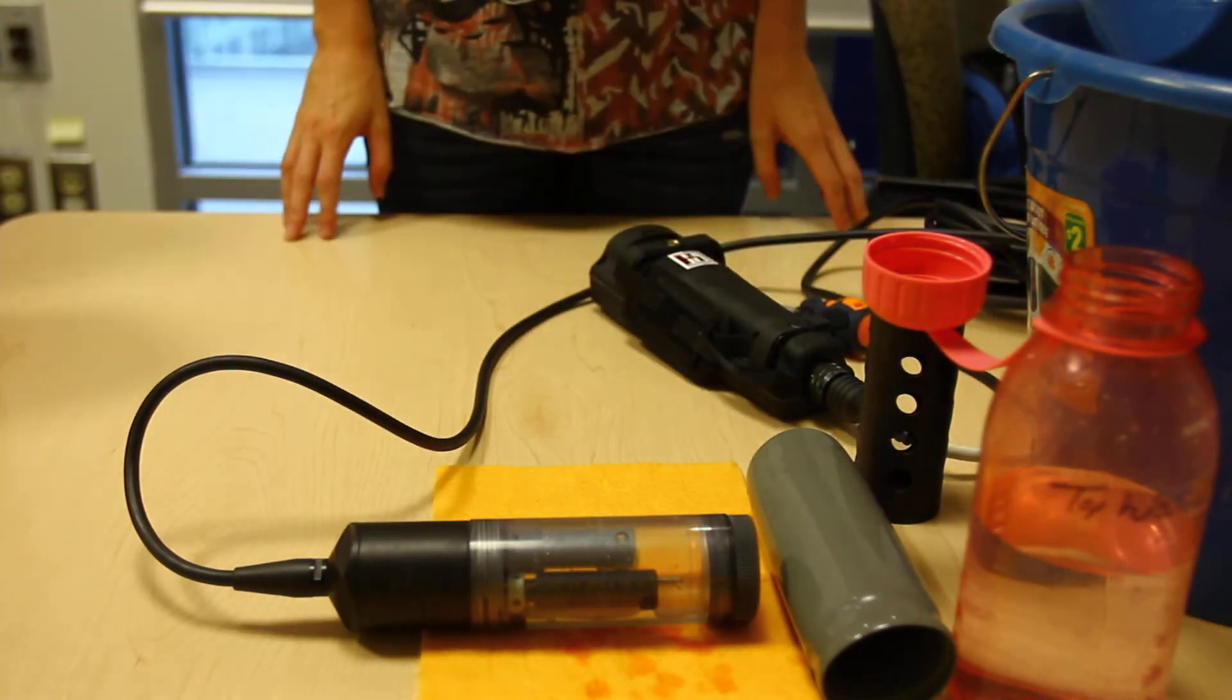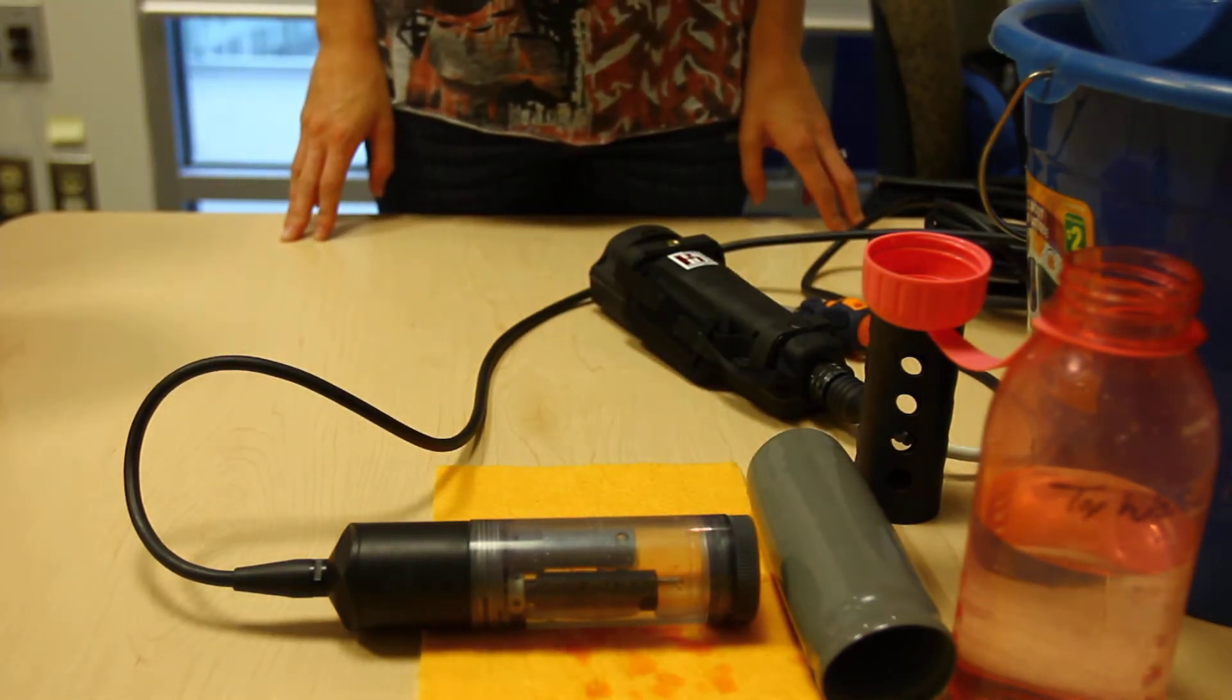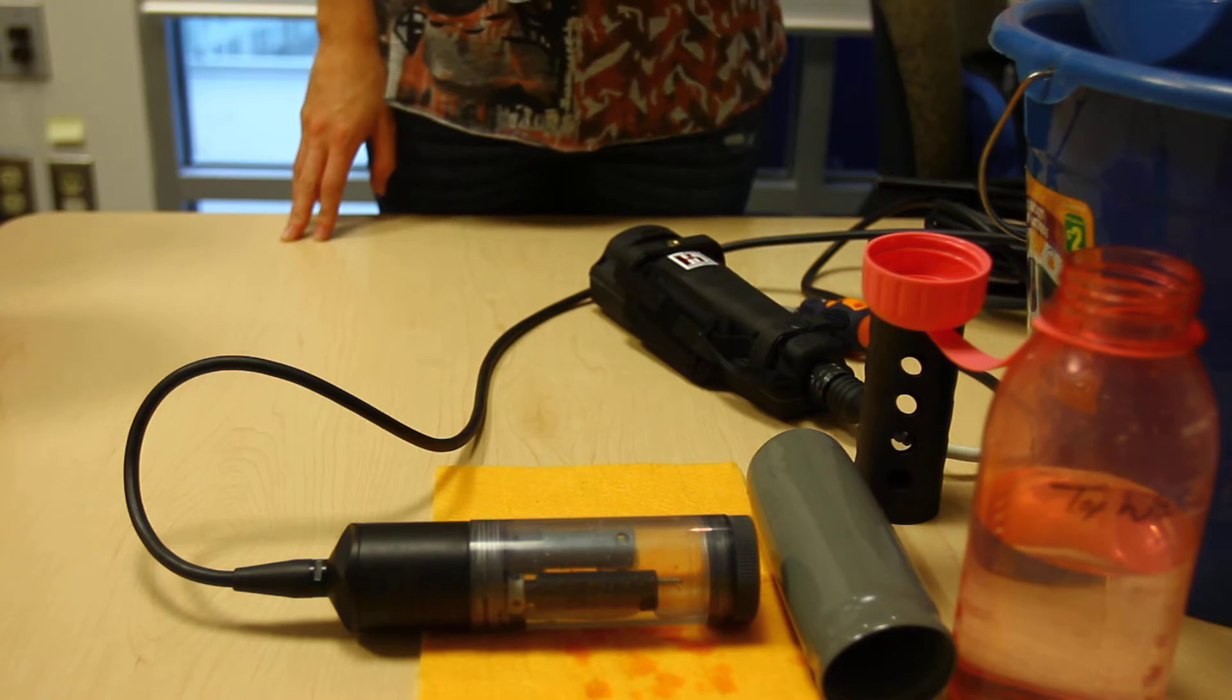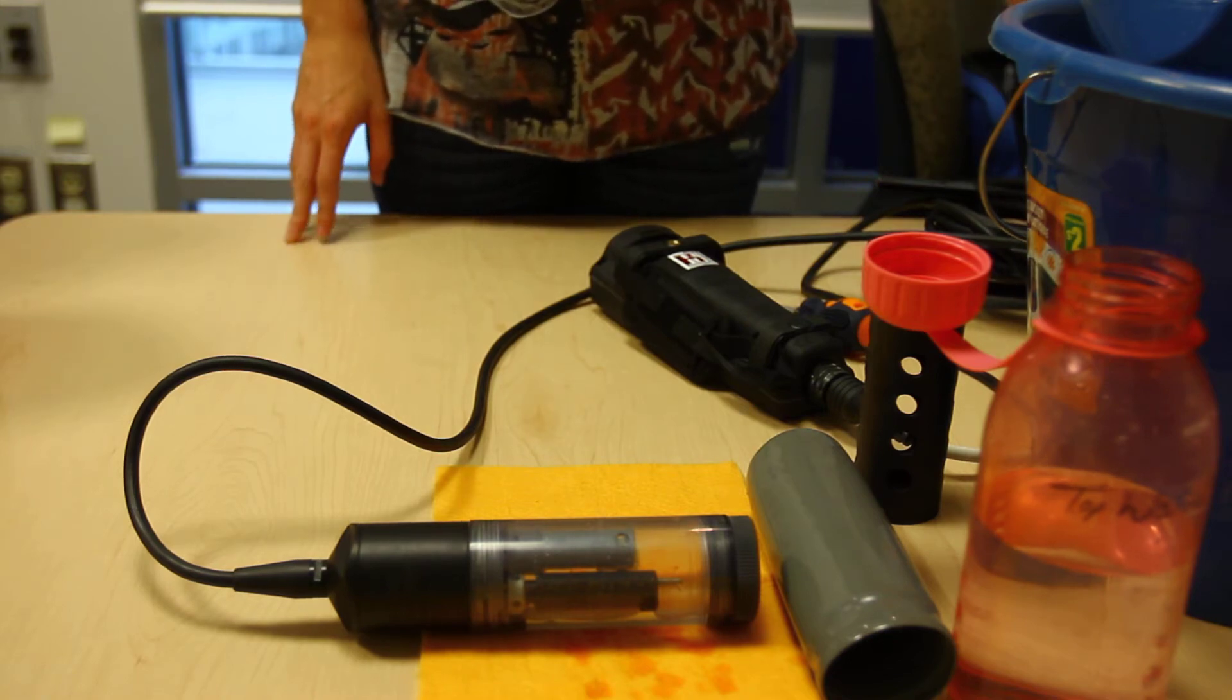For long-term storage, for over 30 days, you would want to fully submerge all your sensors in used pH 4 solution.